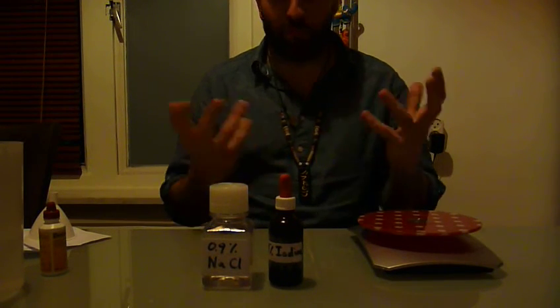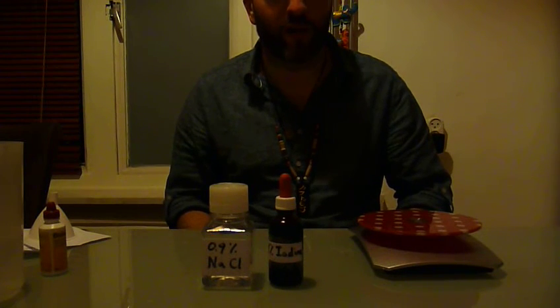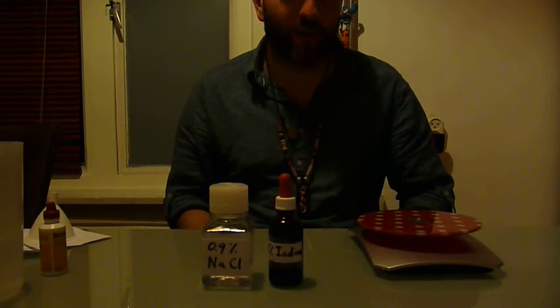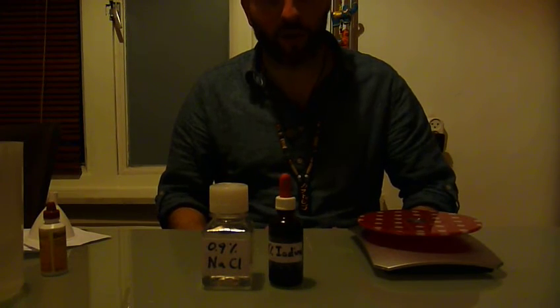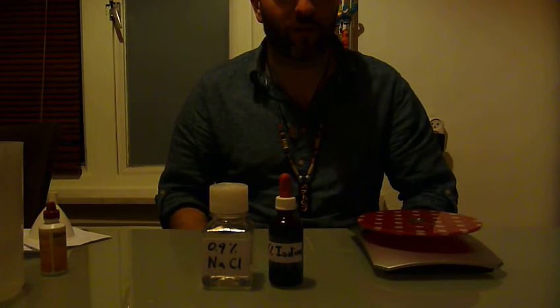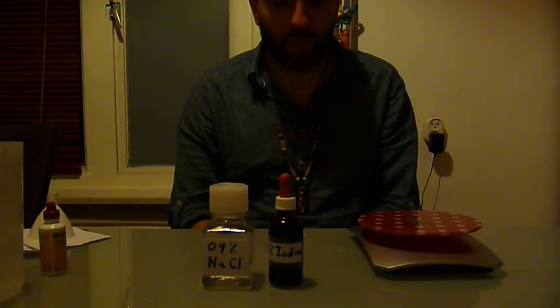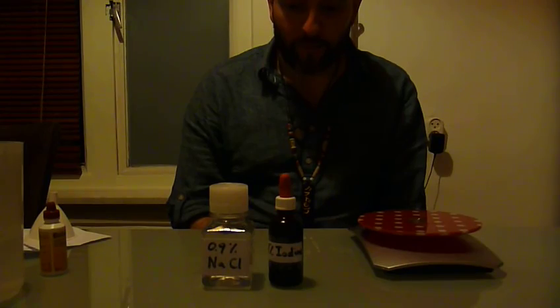It will be a bit of experimenting — I've never done this. Plus, I'll have to improvise a bit because of course I don't have a contaminated stool sample that contains cysts. So I'm going to experiment a bit with yeast, which looks quite similar on the microscope to the Giardia cysts. We'll give it a try and see what works.